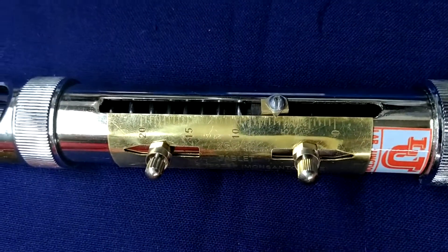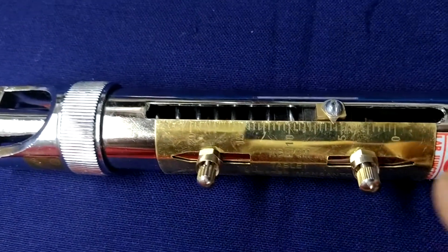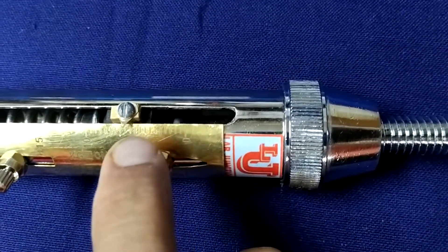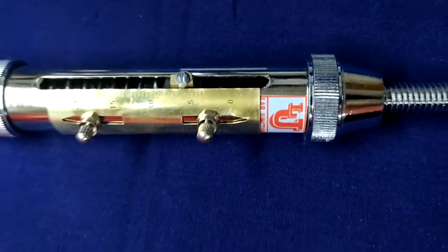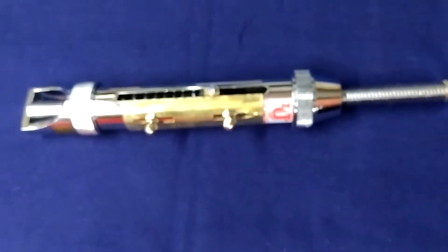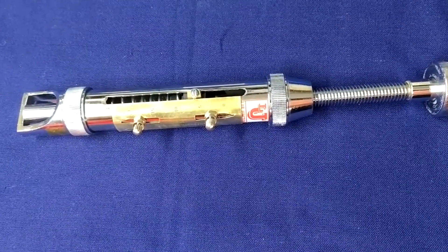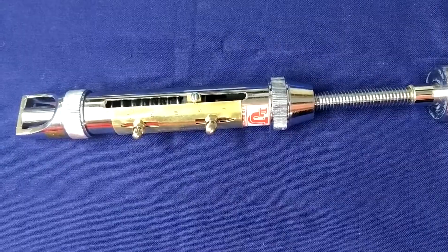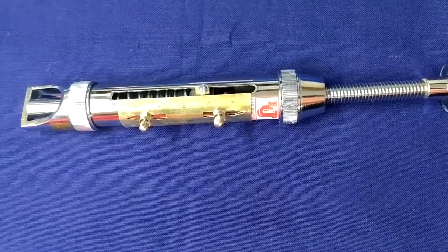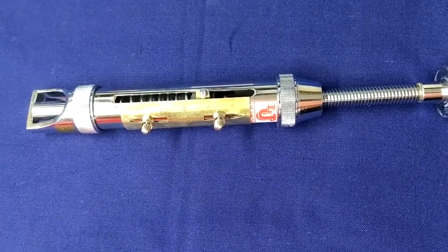The index mark and divisions are in 1 kg increments: 1, 2, 3, 4, 5. Division is in 1 kg. The readings scale is adjustable for zero setting as per the size of the tablets.